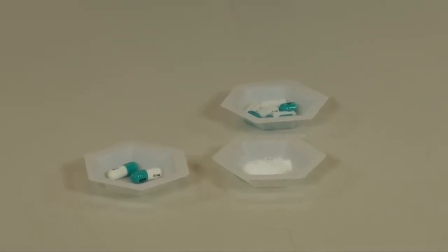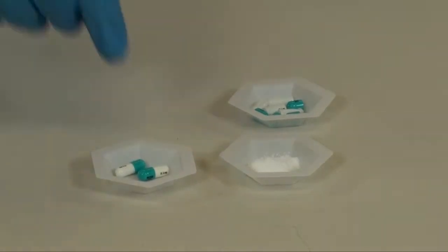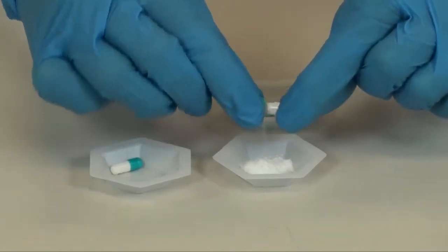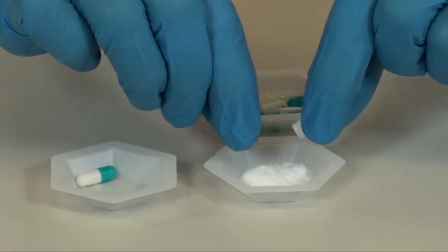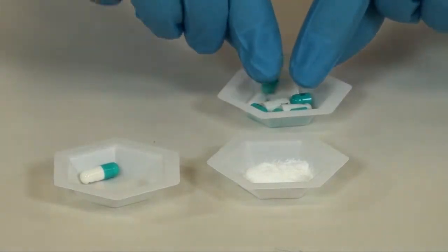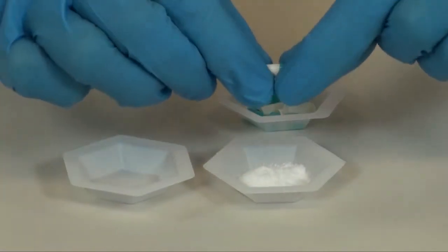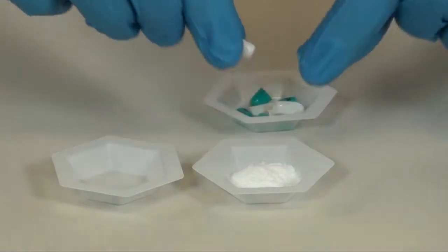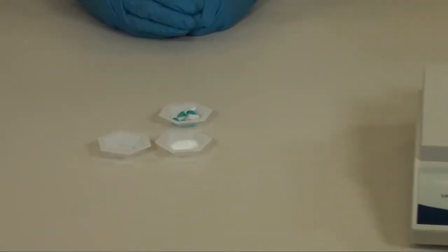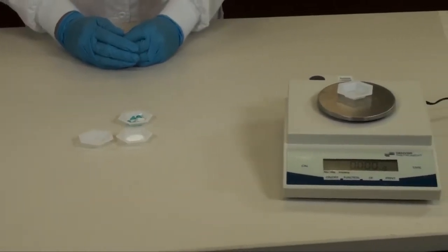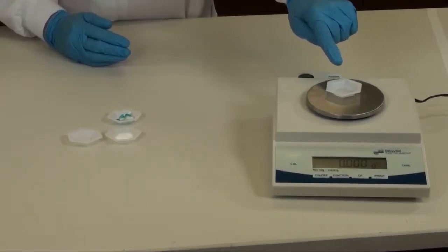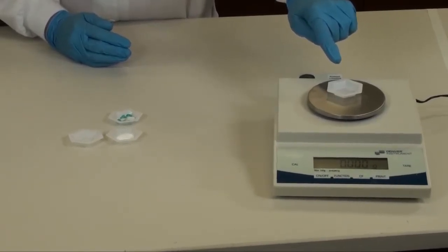You are now ready to open your hydrochlorothiazide capsules to get the active ingredient capsule powder. You are now ready to weigh your active ingredient capsule powder. Remember to tare your scale with a clean weigh boat prior to weighing your capsule powder.